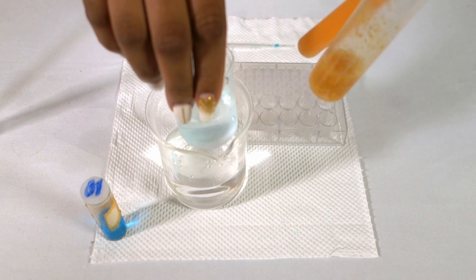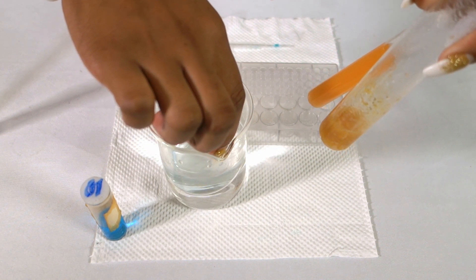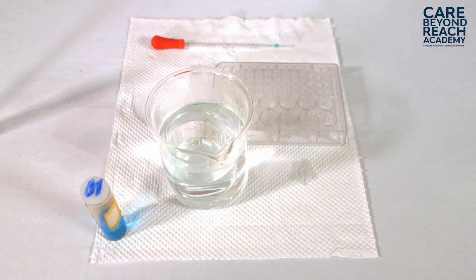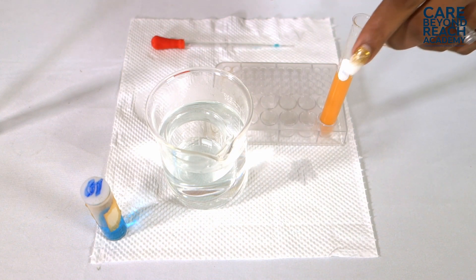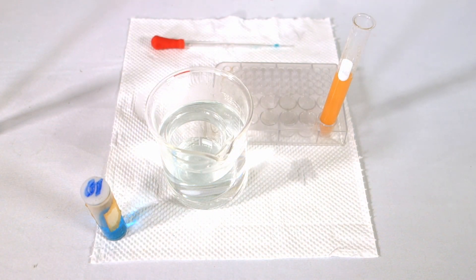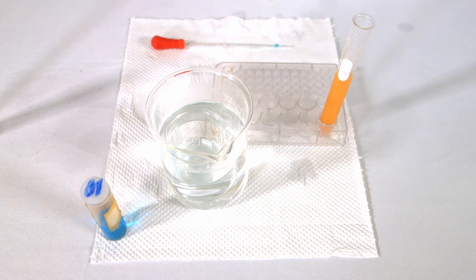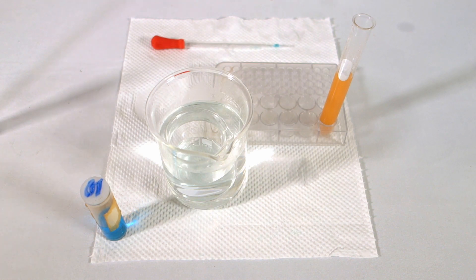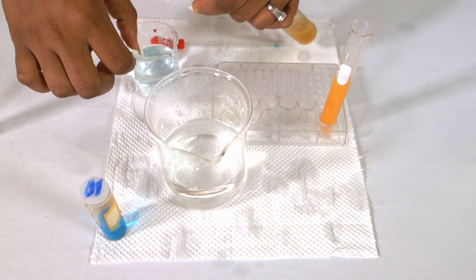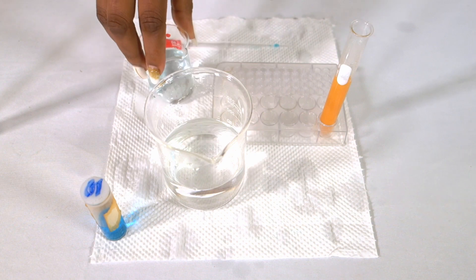We can see that in this experiment, the commercial glucose solution changed color and the banana mixture also changed color. Our control, which was the water, did not change color, so it remained blue. So we can definitely say there was a positive test for our commercial glucose and the banana. And that is our reducing sugar test using Benedict's solution.